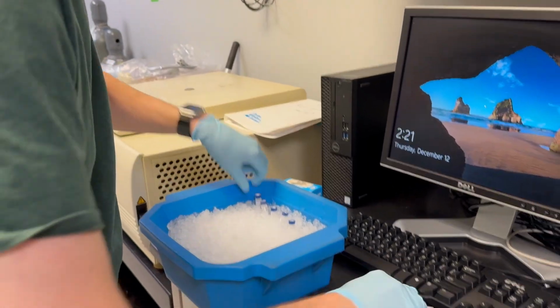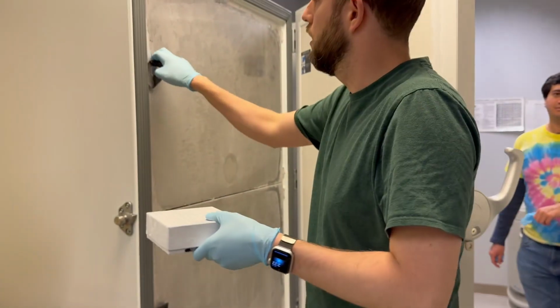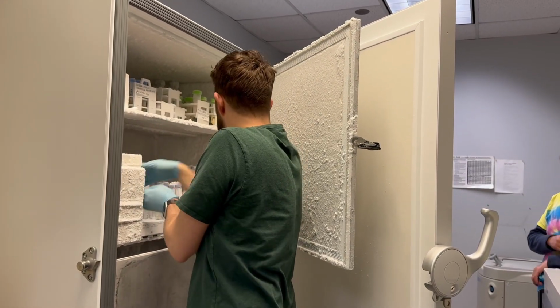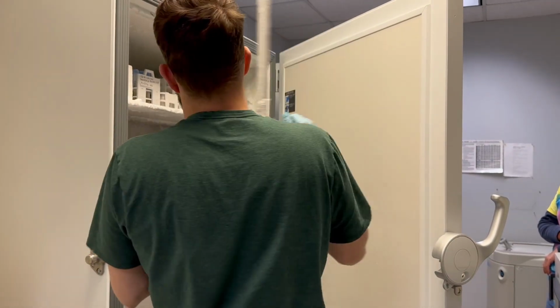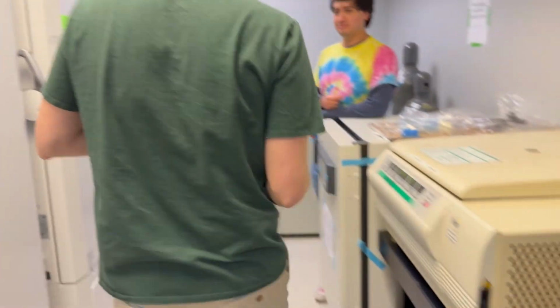Okay, terrific. So I'll put the top back on, put this back inside. All right, we'll head back over.